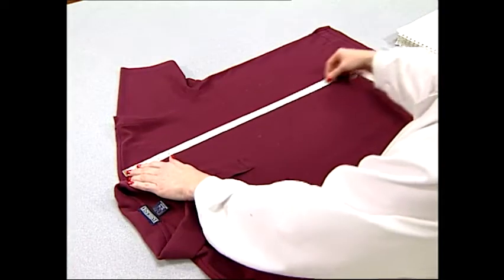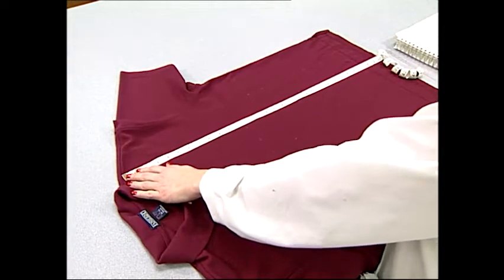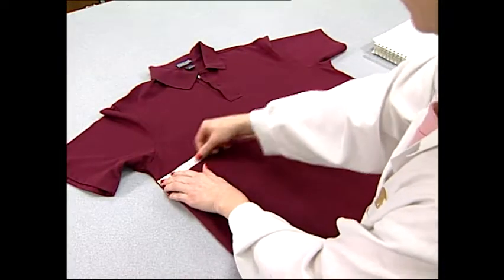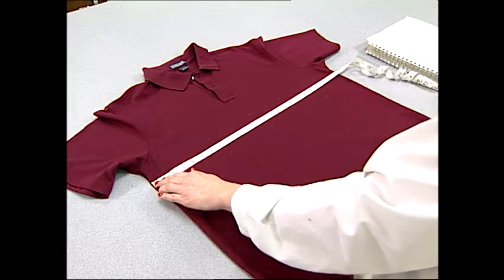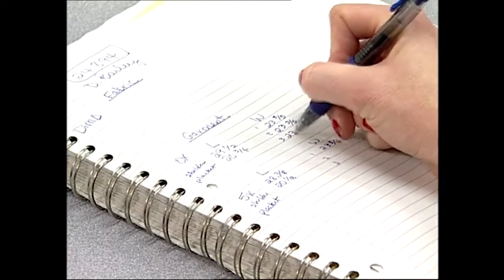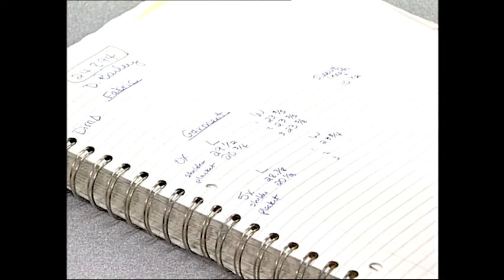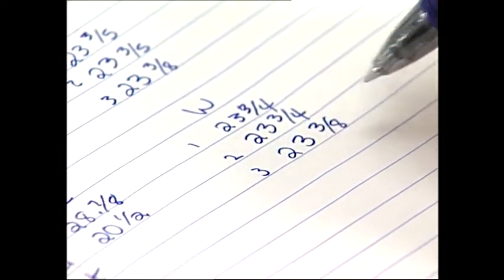The next step is the evaluation or measurement of the change in dimensions. Each specimen must have its benchmarks measured. In knit constructions, the length is the wale direction and the width is the course direction. In woven constructions, the length is called the warp and the width is called the filling. Record the distances or a percentage dimensional change and enter onto a tally sheet or into a spreadsheet. The value should be reported as an average percent dimensional change to the nearest 0.1% for each fabric direction.